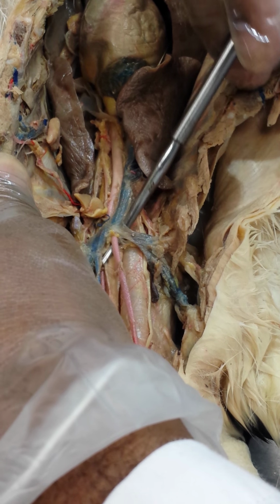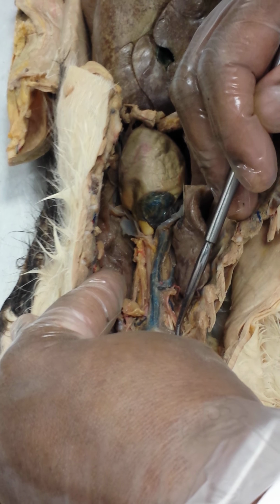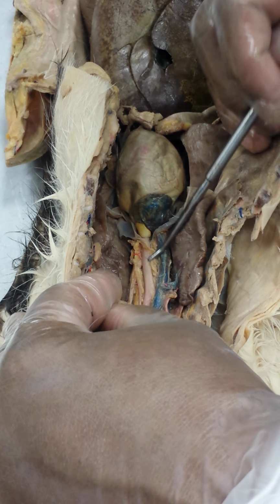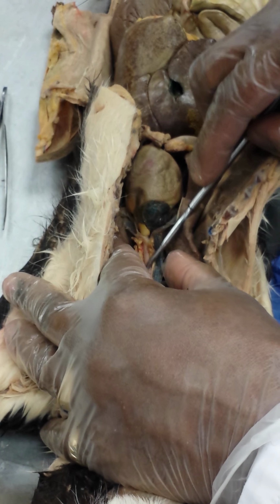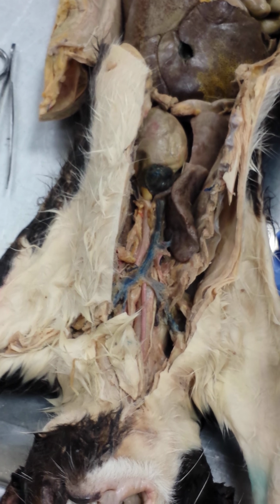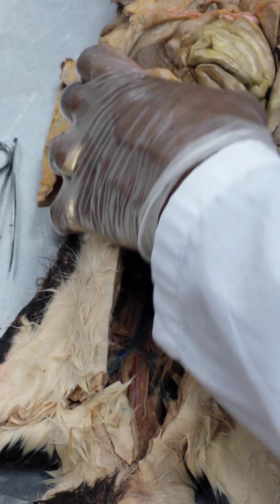All right. So that's important to note, that the right on the arterial side is somewhat slightly different than the venous side. The venous side gives you the superior vena cava, giving a right and a left brachiocephalic vein. On the arterial side, you have a larger brachiocephalic on the right, and on the left you have the subclavian artery. Okay? All right. You're good with the other structures? All right.